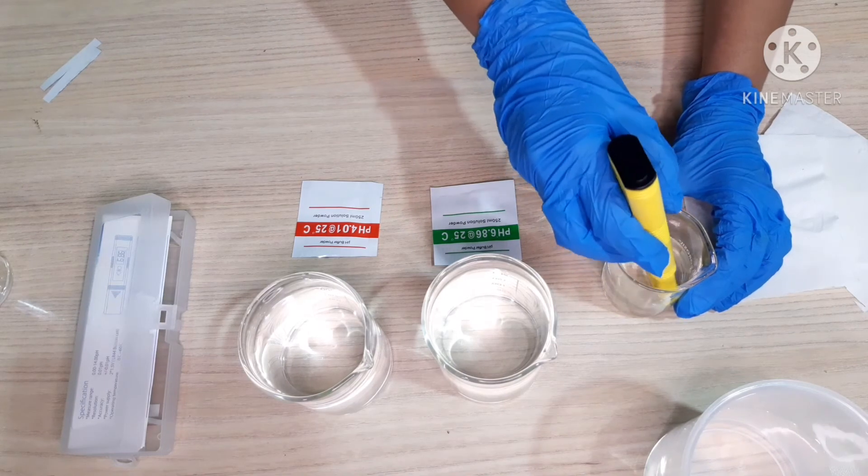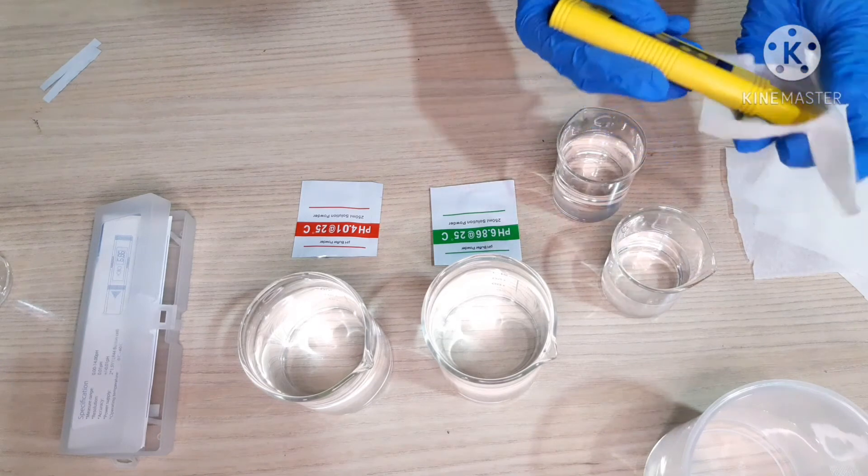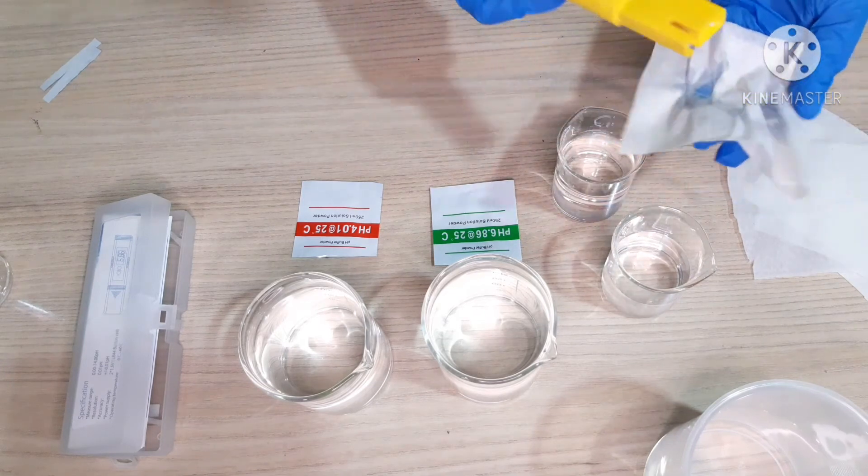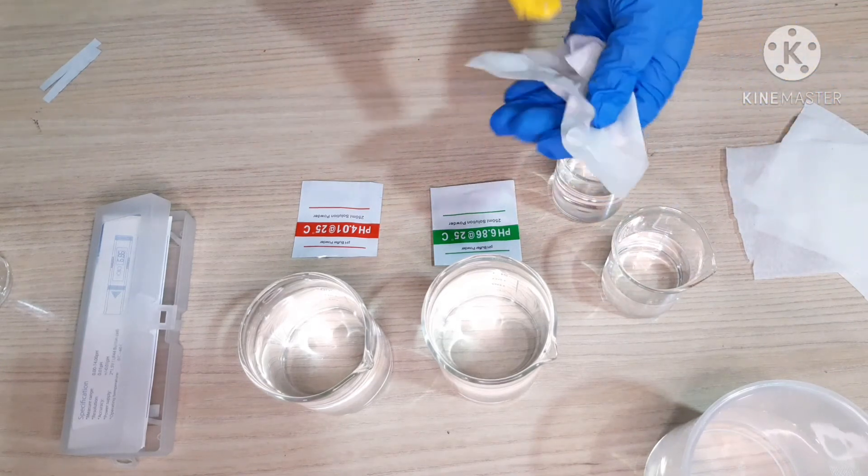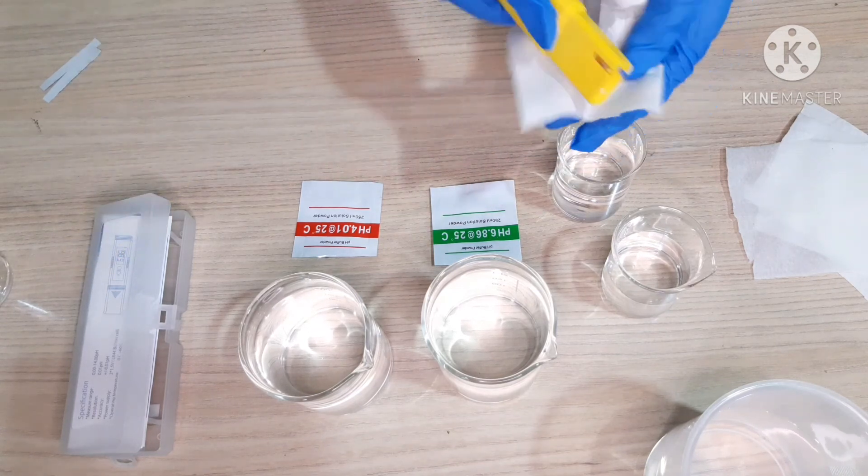I am cleaning it with the distilled water again. That's it. This can be stored in the box again once it is dried.